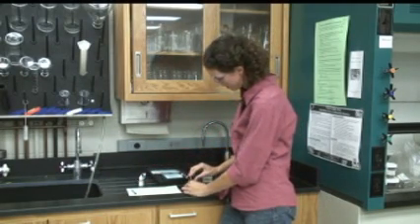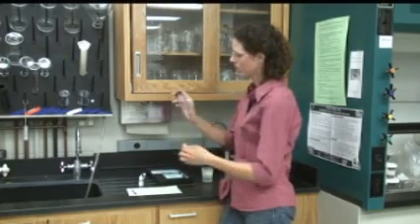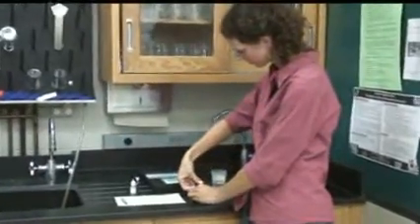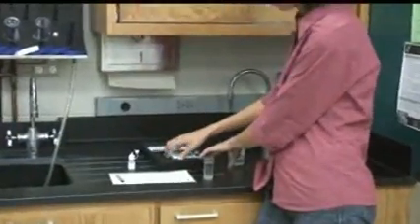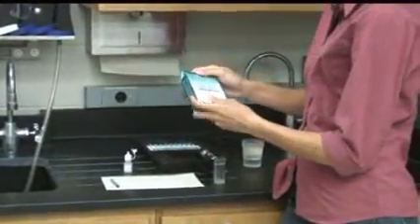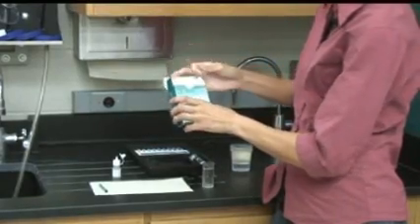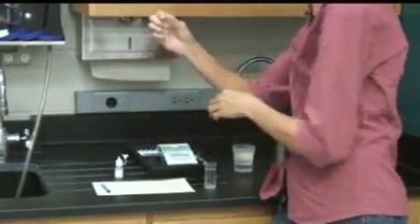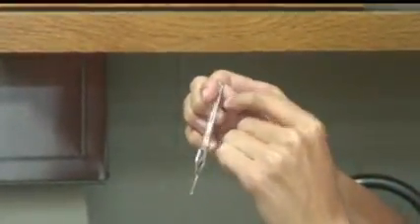Put the lid on the bottle and shake briefly to mix. Pull the lid off. Remove one of the glass ampoules from the box. These are under vacuum, so that when you break the tip off of the ampoule under water, it sucks up the solution.